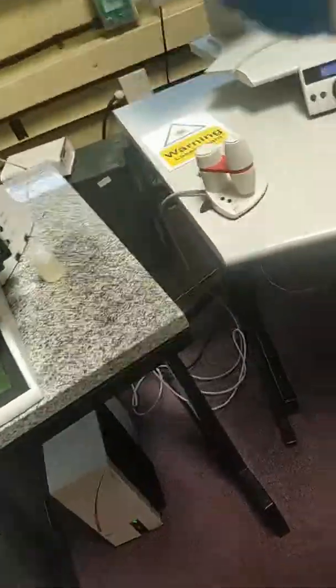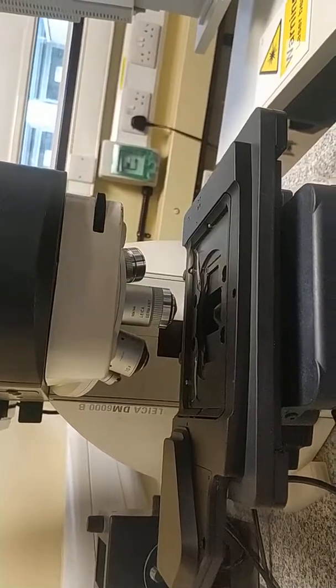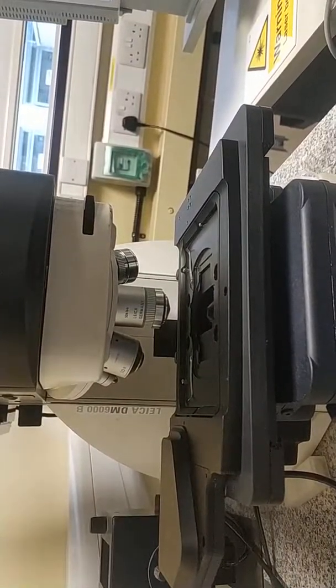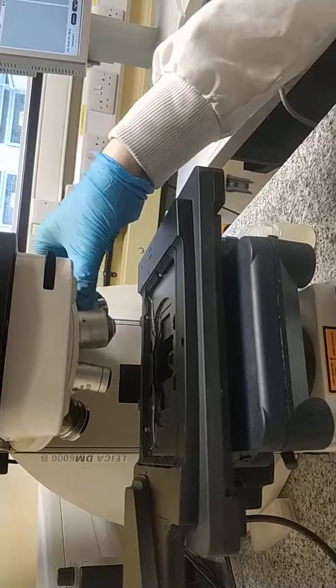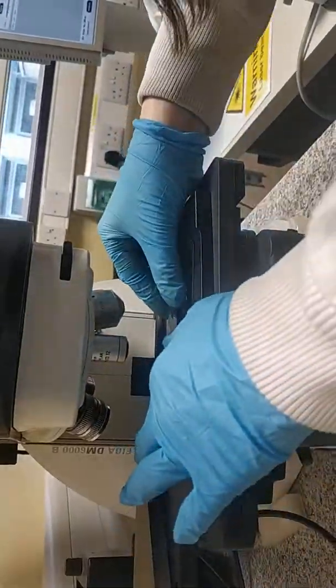For example, it will be mixed. Okay, so now once you have it prepared, you place it here. So this is just to hold the sample. You can open them. It's better to always go as far as possible from the, now it's in the minimum, and also if possible in the smaller objective because it's farther, so you have more space to work.